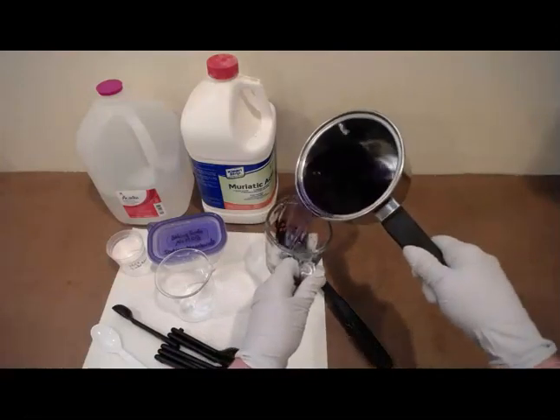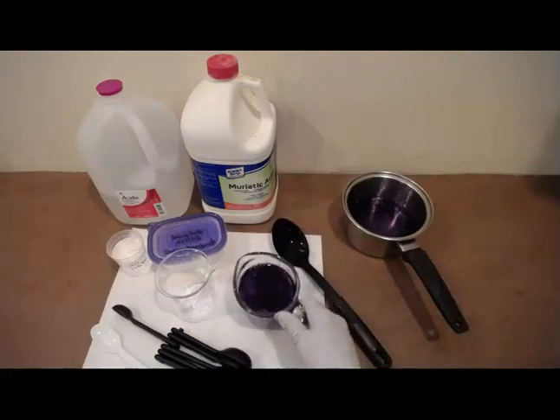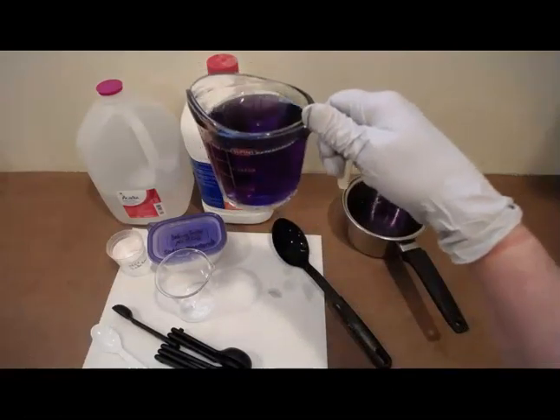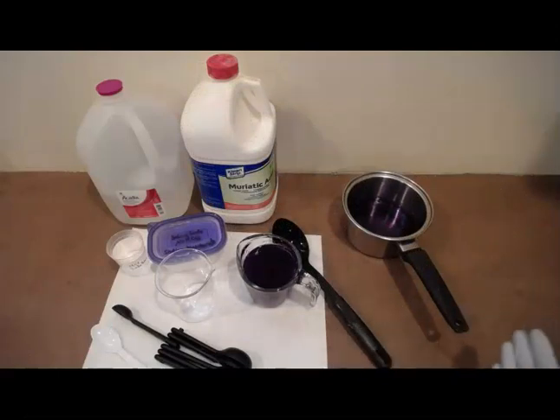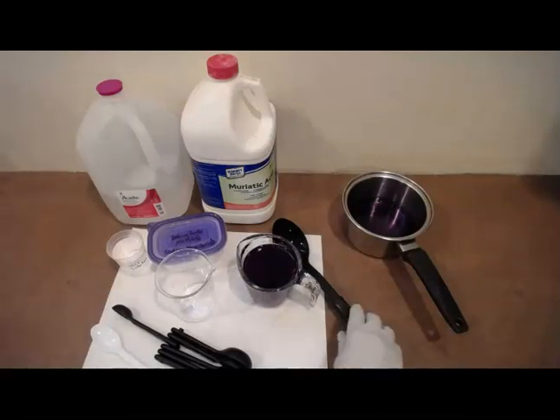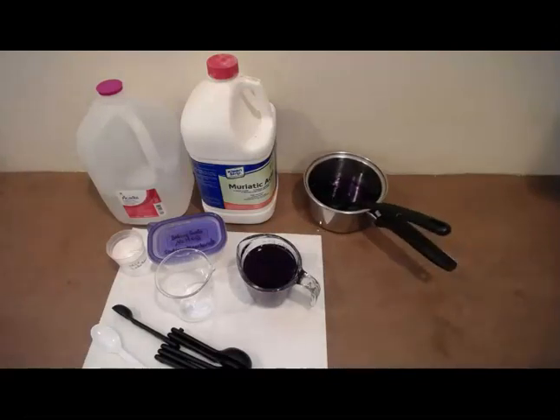Okay, so we're going to pour that in. Okay, and it's that nice purple color. Remember, you want your indicator solution to be a nice purple color, indicating that it is neutral. If it is more on the pink side, or if it's more on the blue side, you have some type of a contaminant. So that's part of why we rinse with distilled water to begin with, but do make sure that it is purple.